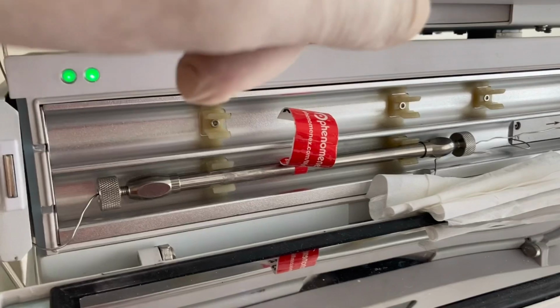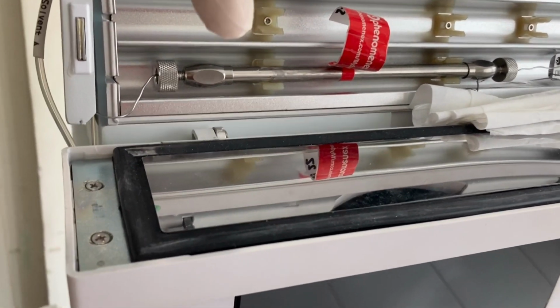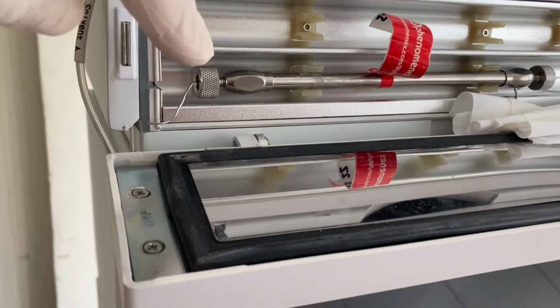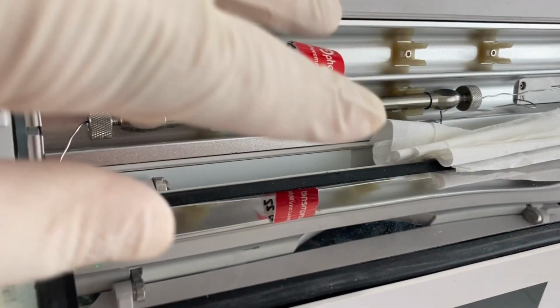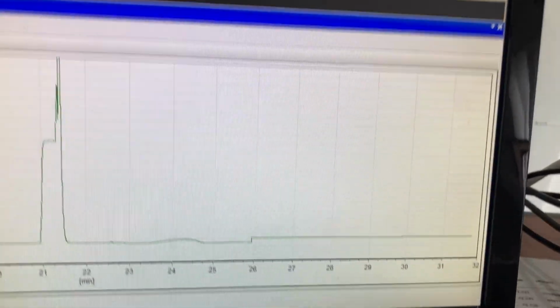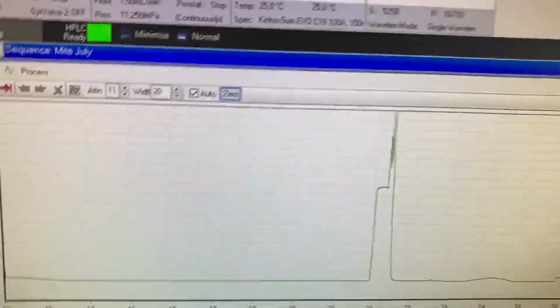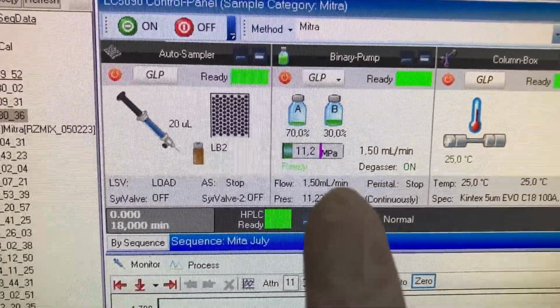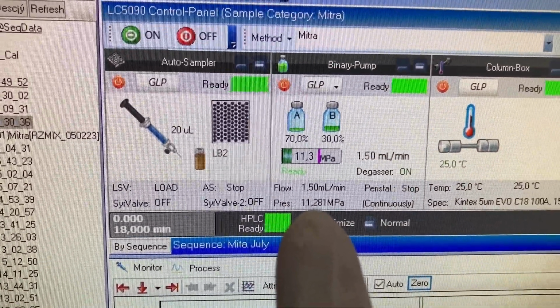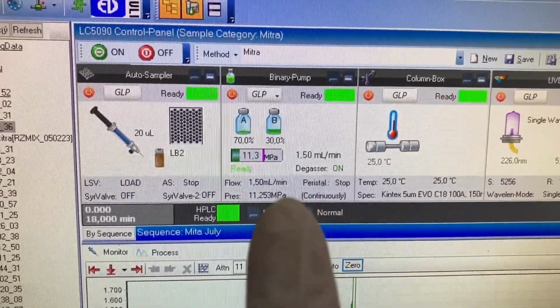So I played around with it. I changed the connectors and the ferrules end to end, because this one's always been very stable, and I've run out of new ferrules. It's holding so far. As you can see, I'm wearing gloves because I don't want the solvent on my skin, and it's running relatively stable, but it's only running at about 11 megapascals, which is very low pressure. It's got to get right up to about 30. So we'll see what happens. We might try a run, and if it holds, bloody good, otherwise bugger.